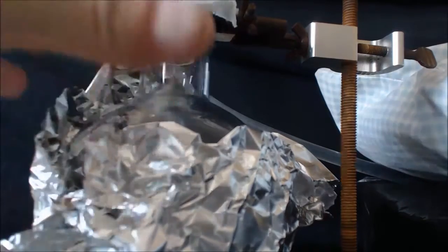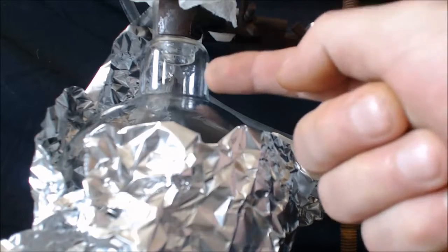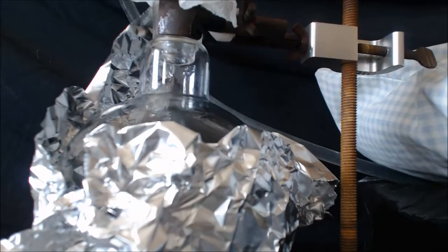I got that tin foil up so it keeps all the heat in around the flask, but you can see it's starting to reflux. Here comes the drip right now.